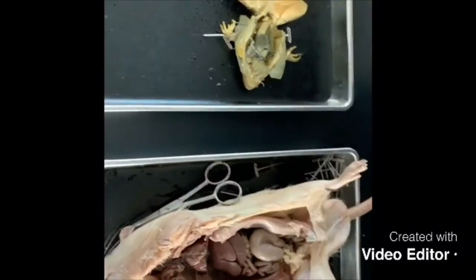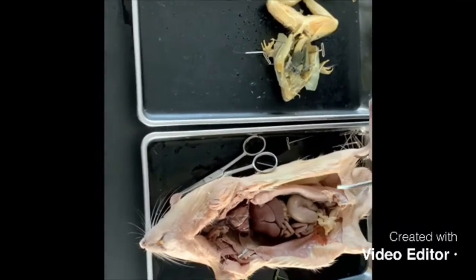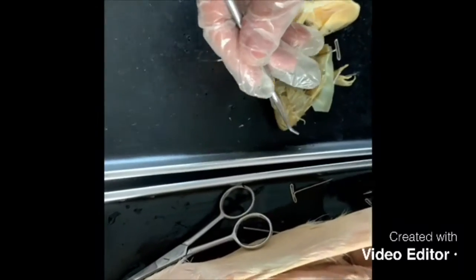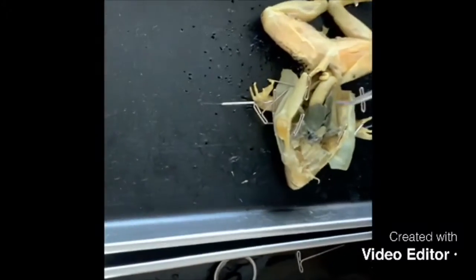To identify parts of the digestive system of both animals: it is a group of organs working together to convert food into energy and basic nutrients to feed the entire body. Digestion in the frog begins at the mouth. It has teeth, but they're basically useless. The teeth are basically assisting the tongue with eating. While in the rat, we do see teeth, and they're used for chewing. Digestion in the frog continues at the stomach, and so does the rat's.